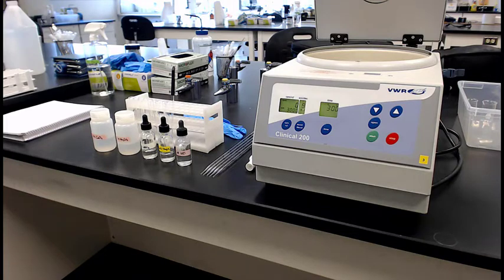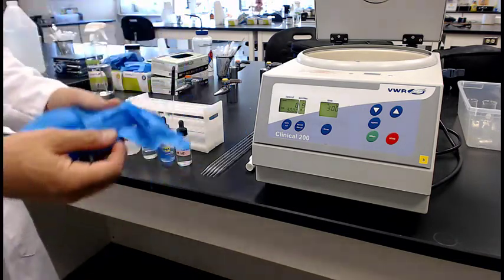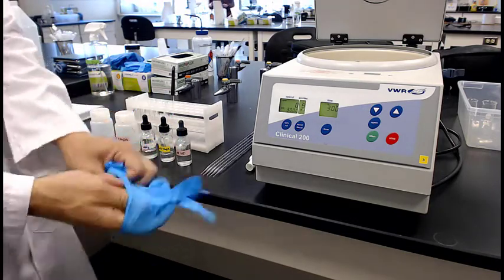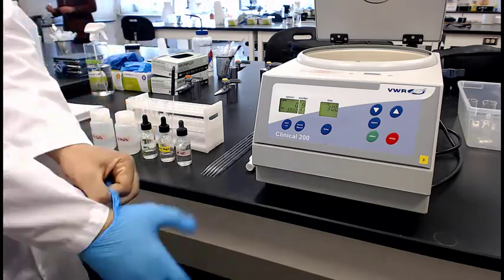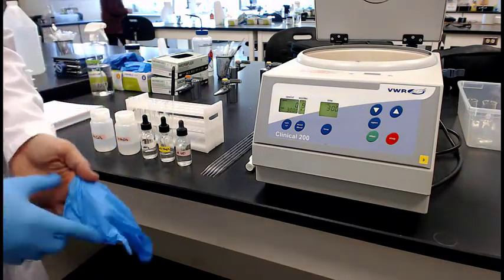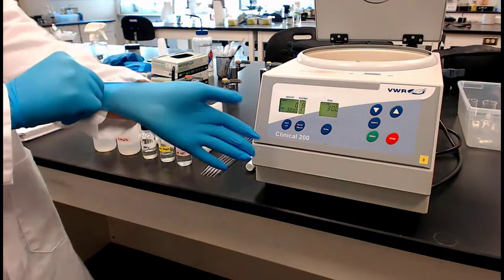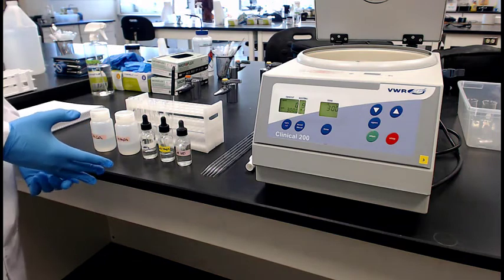Okay, so this particular reaction is going to be a little different. You're going to be doing some precipitation, and you're going to spin it down in a centrifuge. So John's got his centrifuge out. He's on track today. He's going for his gloves right away, so that's good. And again, we're working on procedure C, so follow along in the lab book so you know where you're at. This is procedure C, starting on part C, page 8.